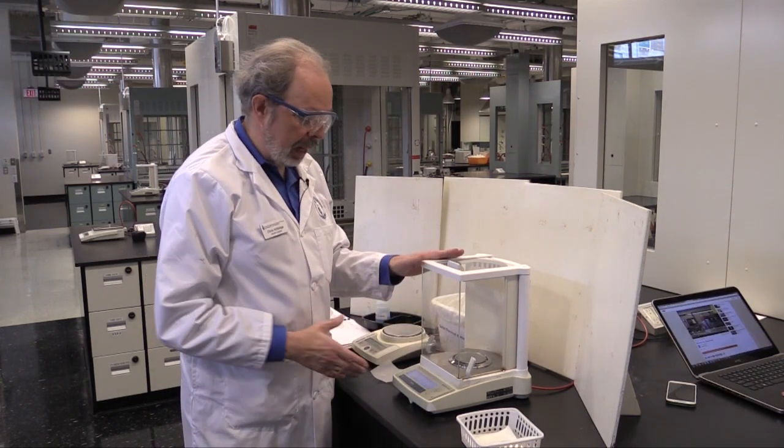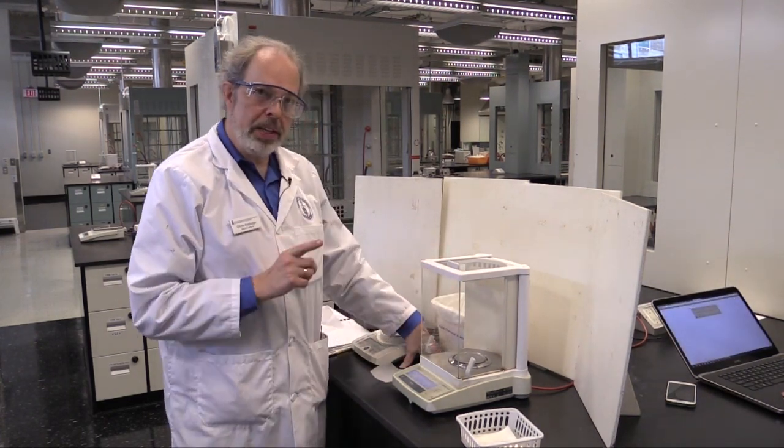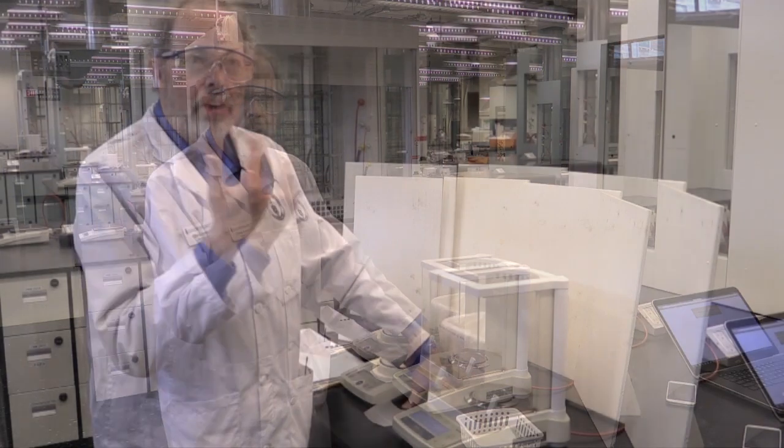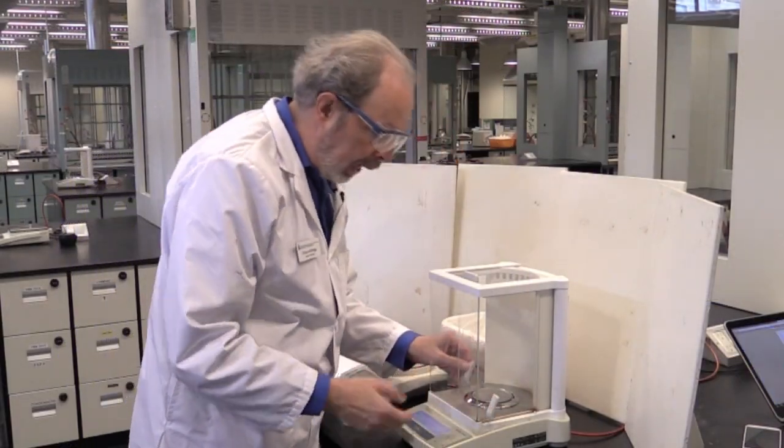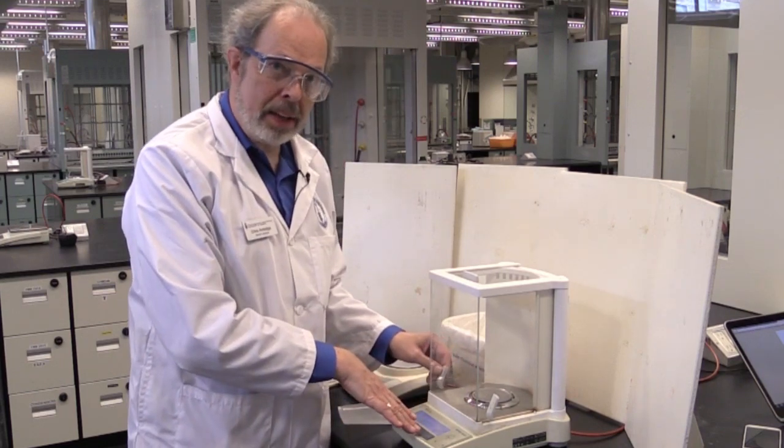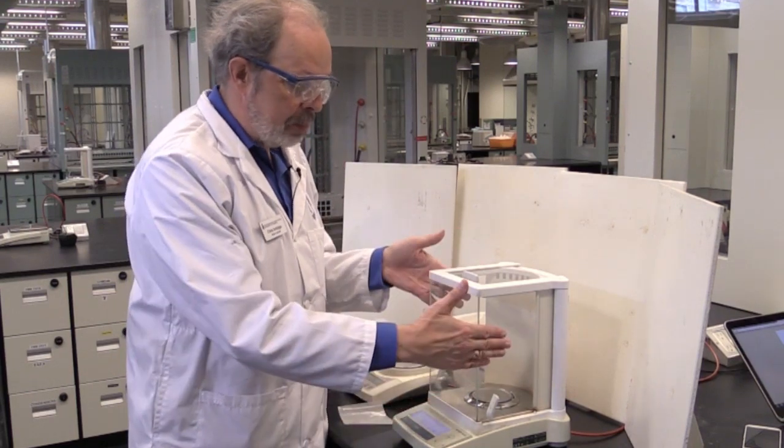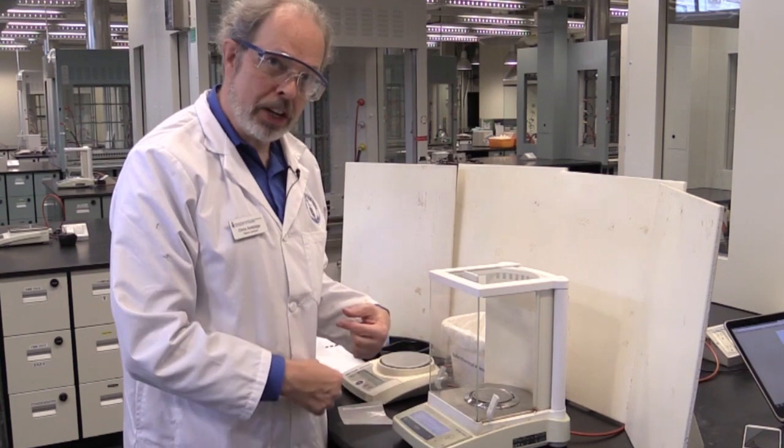Moving on to the analytical balance. It's in the glass case for a reason. There are wind currents just from the air conditioning here. And if I open this and blow on it, I will actually see a different mass. So I do need to keep the glass covers closed when I'm actually taking a weight.